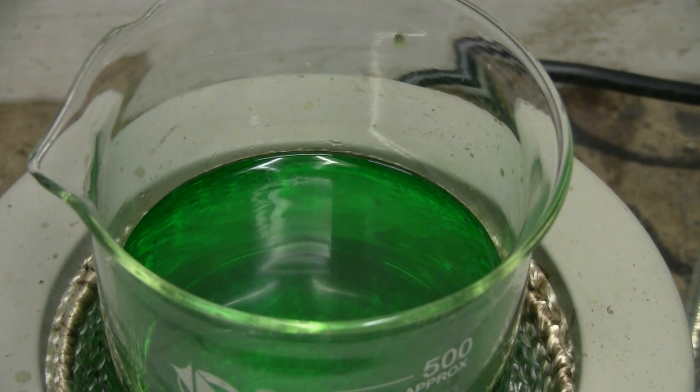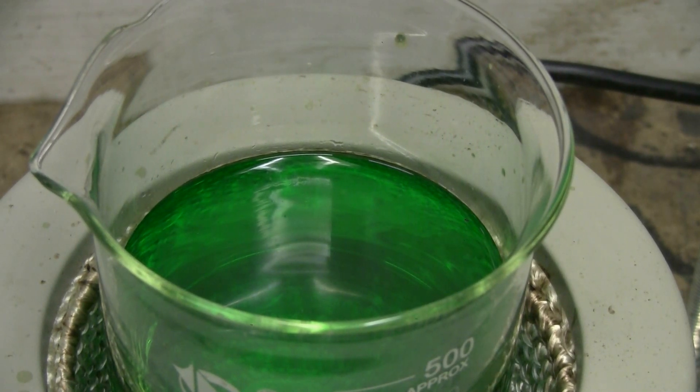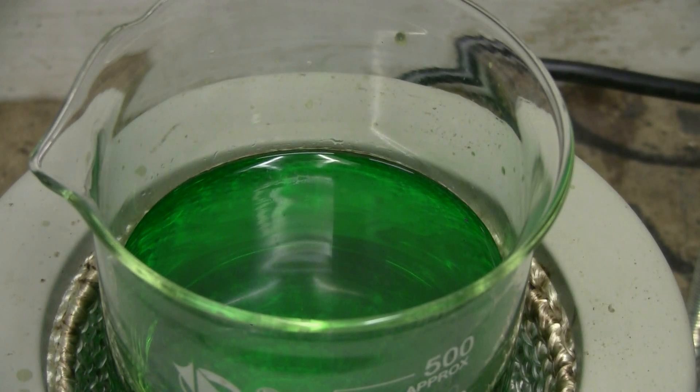While we're waiting for this to heat up and come to boiling, I should point out that sodium metabisulfite solution does give off a faint smell of sulfur dioxide. So if you do this experiment, you probably want to do it with very good ventilation so you don't get the smell. Either do it outside, under a fume hood, or somewhere where you have very powerful ventilation.